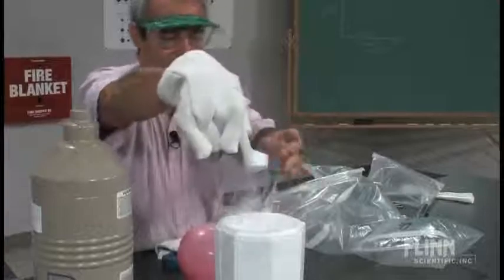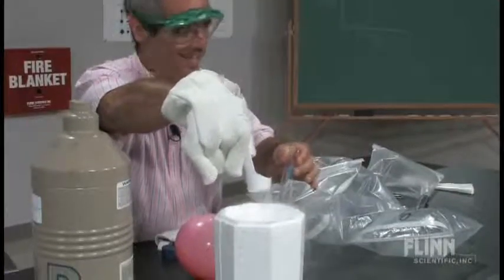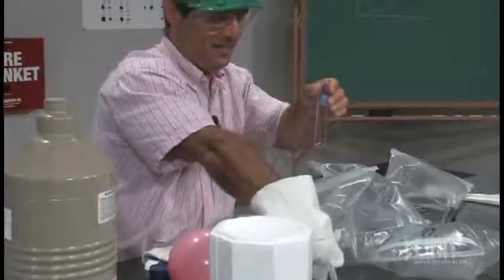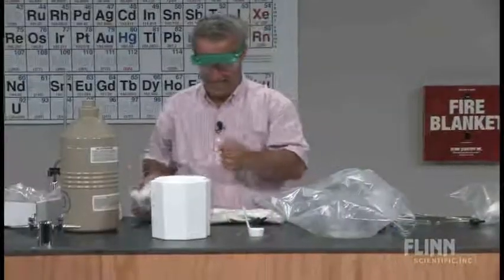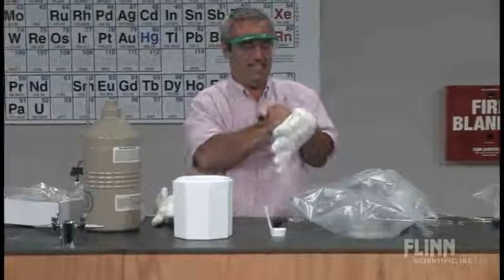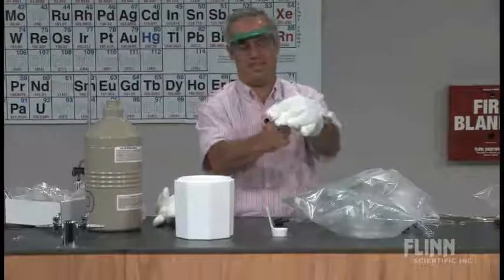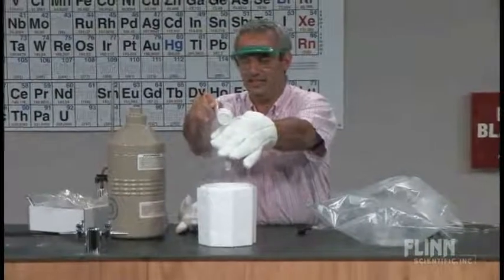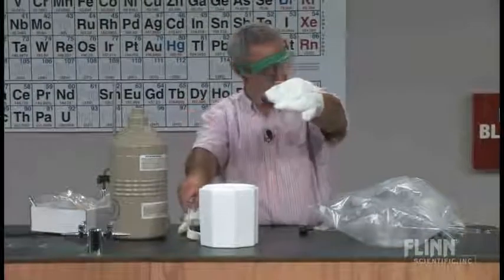I'm not really coming in contact with it, but it's a good idea to use these gloves. This liquid nitrogen is obviously one of the coldest things you're going to have to deal with. This might be overkill, because all I want to do is scoop out a little bit of it with this little styrofoam ladle, and put it in my nitrogen test tube. So let me reach down in there. Did I get some? Yep.